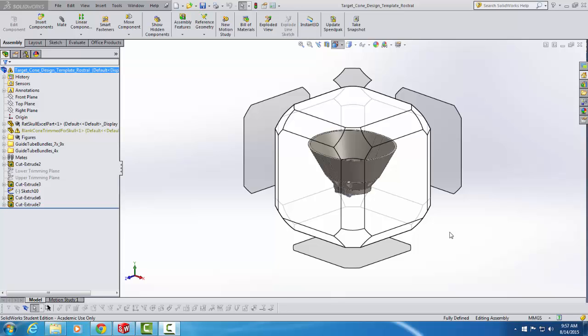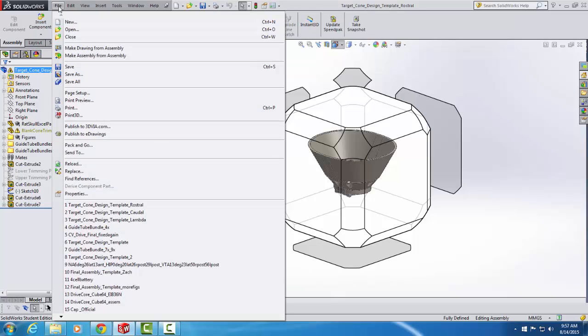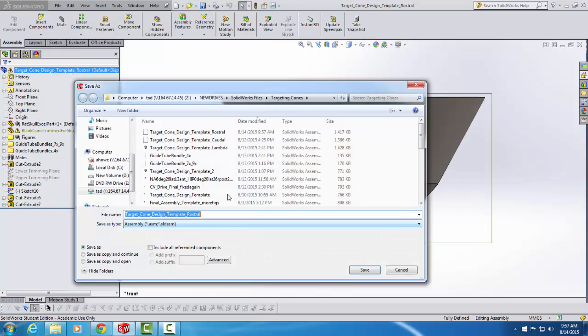In this video, I'm going to teach you how to customize the targeting cone to meet your specific experimental needs. The very first thing I'm going to do is click Save As under the File menu to resave the targeting cone template file with a name that corresponds to the experiment that I plan to conduct.